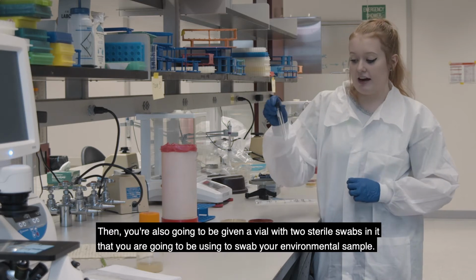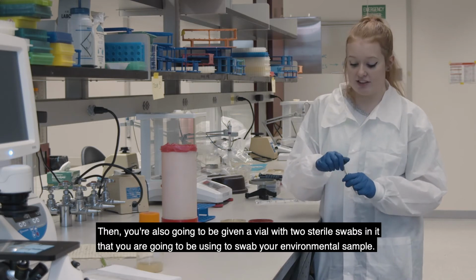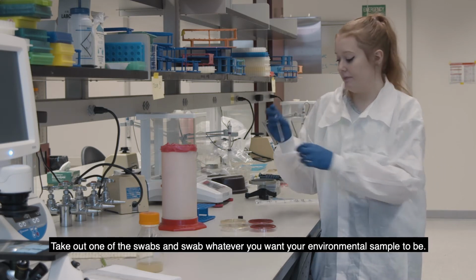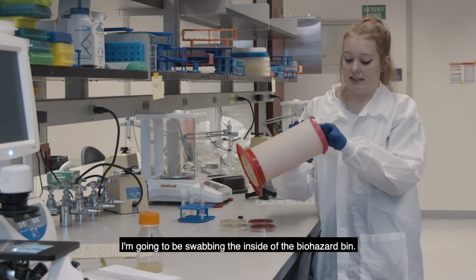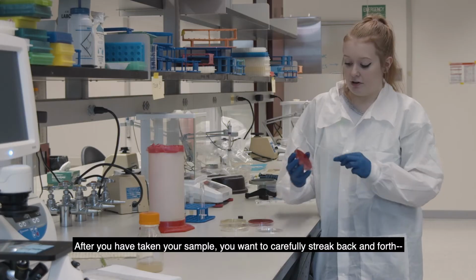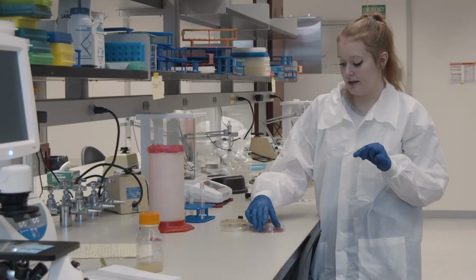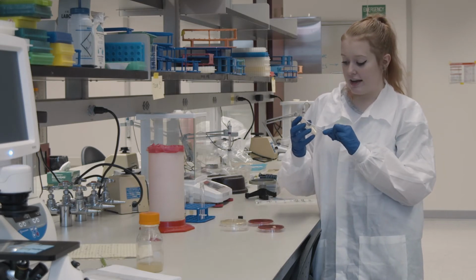Then you're also going to be given a vial with 2 sterile swabs in it that you're going to be using to swab your environmental sample. So just take out one of the swabs and swab whatever you want your environmental sample to be. I'm going to be swabbing the inside of the biohazard bin. And after you've taken your sample, you just want to carefully streak back and forth with the swab covering the entire plate. And you want to repeat that for each of the plates.